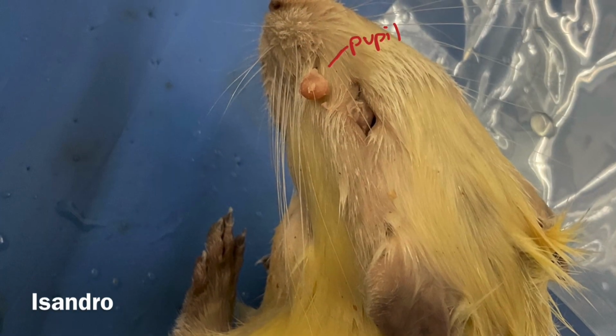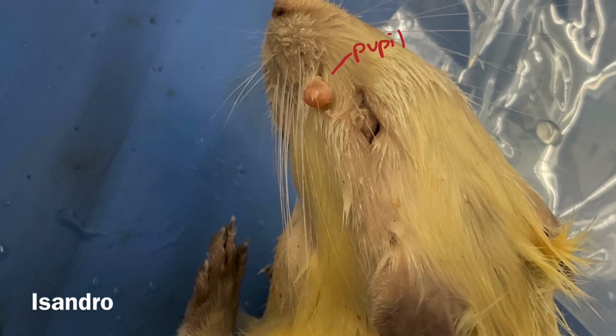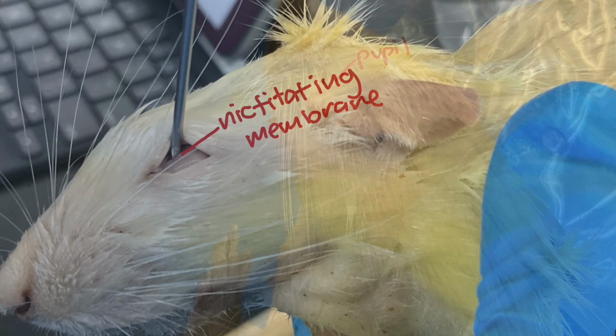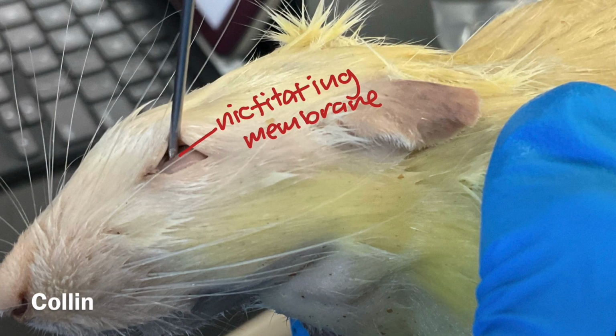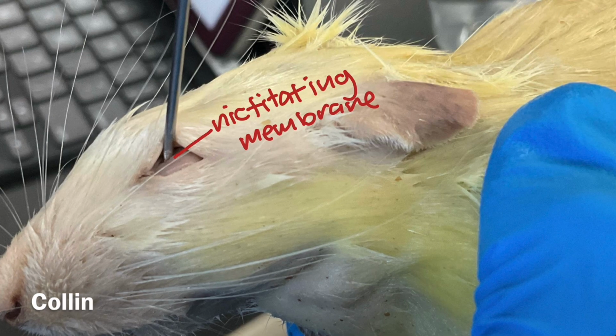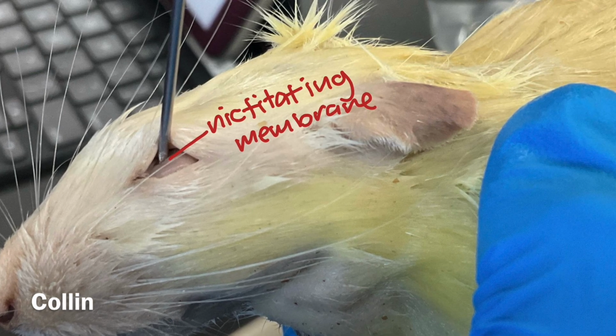The pupil is also located in the cranial region and allows the rat to see and regulates the amount of light entering the retina. The nictitating membrane is located in the cranial region and is a thin, translucent eyelid located at the medial corner of the eye. It helps keep the eye moist.